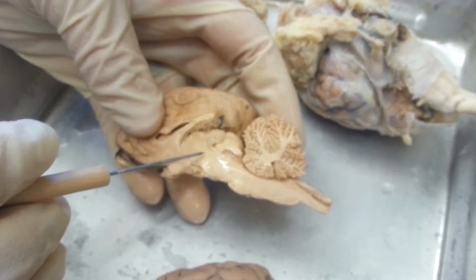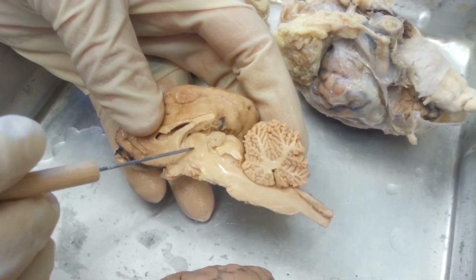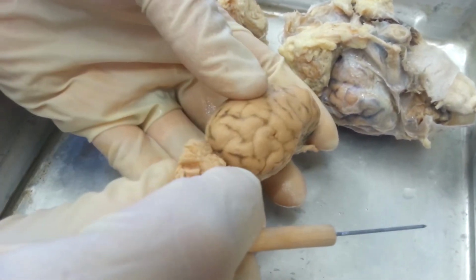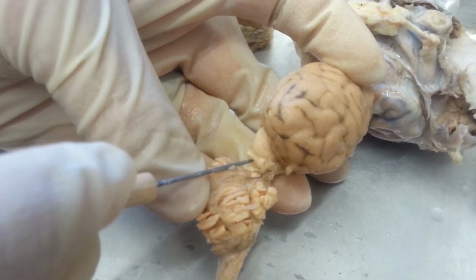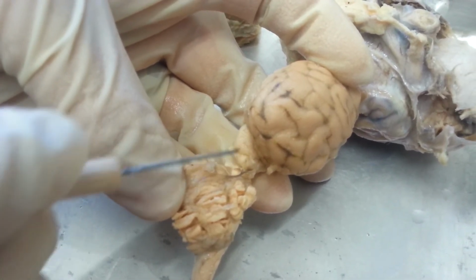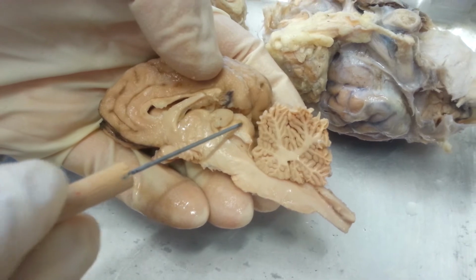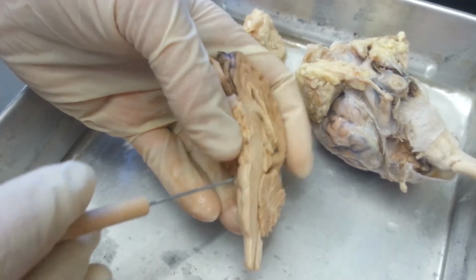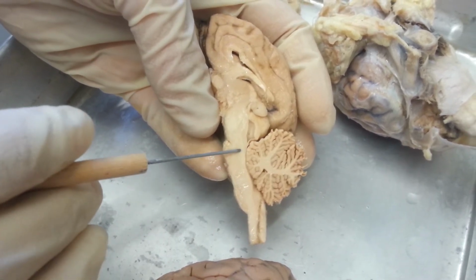So the thalamus, again, is this big ball in the middle, and the ball there is called the intermediate mass. Then you have the tectum, which is made of your corpora quadrigemina. The easiest way to find it is to pull the cerebellum and the cerebrum apart, and you can see those two raised portions that make up the corpora quadrigemina. The superior one is the superior colliculus, and the inferior one is the inferior colliculus. From the side, this is what they look like. When you get to the brainstem, you have the pons, which is this raised portion here, and the medulla oblongata is this region here.